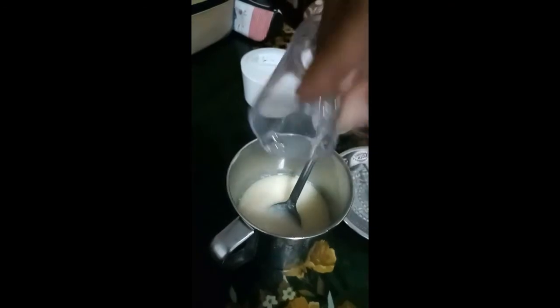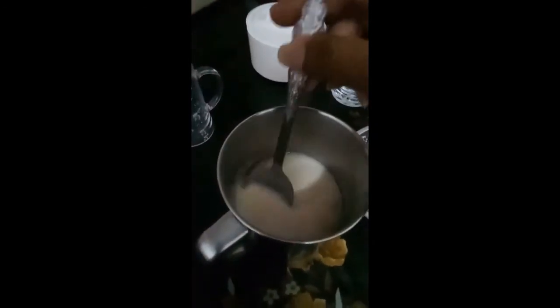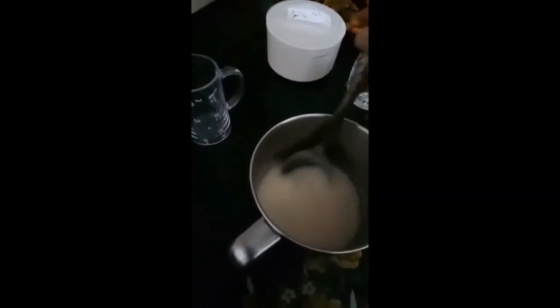Just like the full cream milk, during the low fat milk precipitation, the milk pH reaches 4.6. In this, the casein is seen in insoluble form and starts to precipitate.